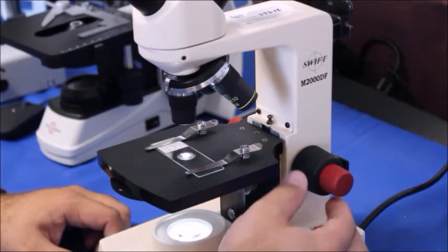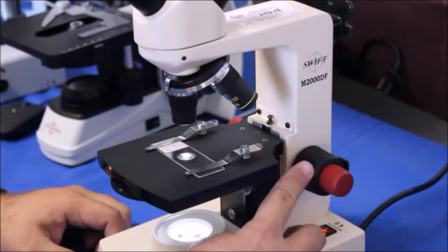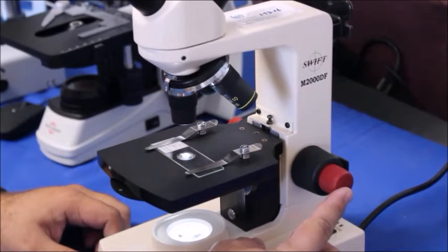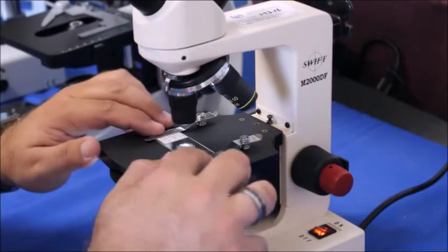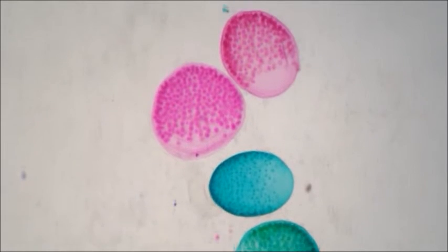We're going to look through here and we're going to turn. This is the coarse focus, and this is the fine focus knob. We're just going to turn this until we start to get an image, and then we'll go ahead and move it towards the center. With the 4x, you can just use the coarse focus and you should be just fine.